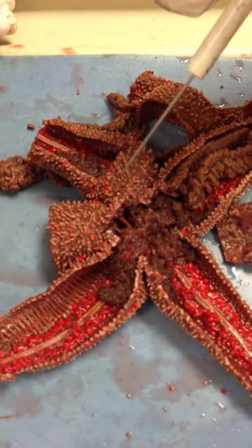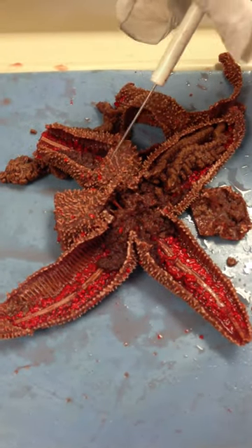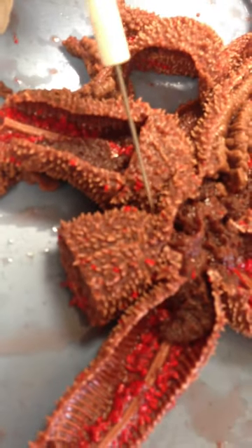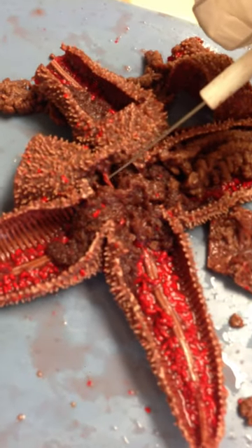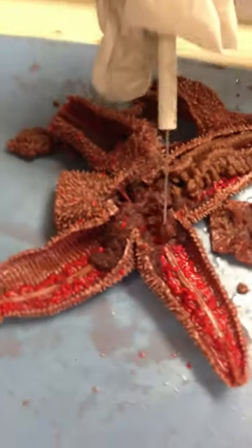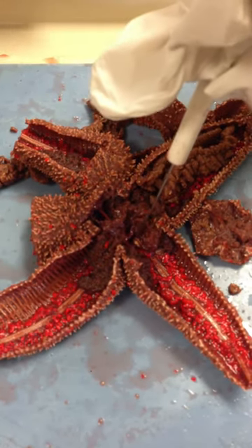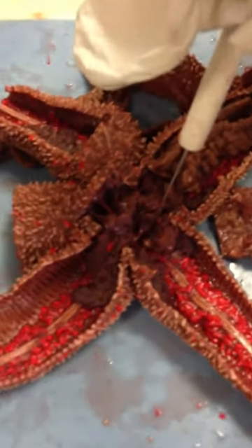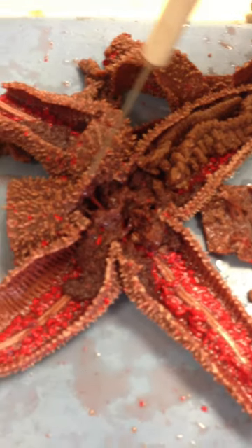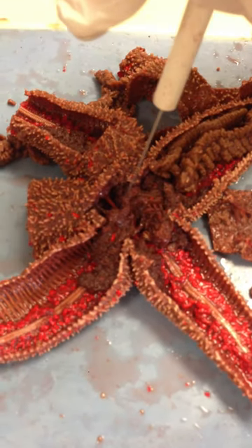This next section we're going to talk about is the water vascular system, and this allows for the organism to transport nutrients as well as to move. Water is going to come in the madreporite, which is this lighter colored region here. It enters through the madreporite and it travels down this tube right here, which is called the stone canal. The stone canal then attaches to the ring canal, and the ring canal is just like it says — it's a ring that is in the central disc.